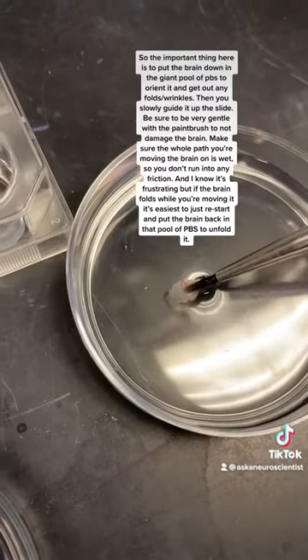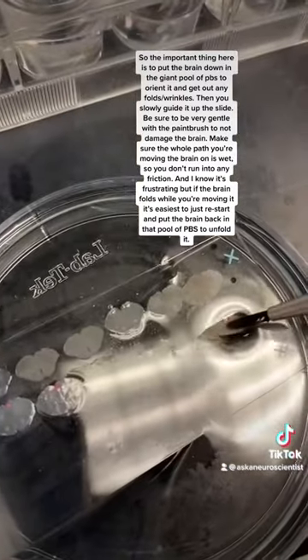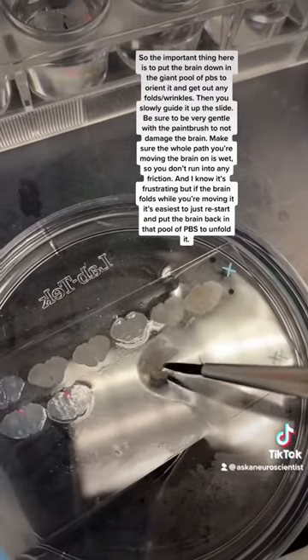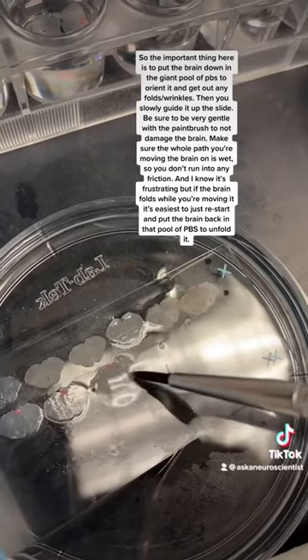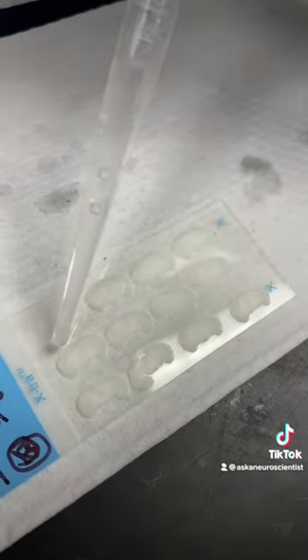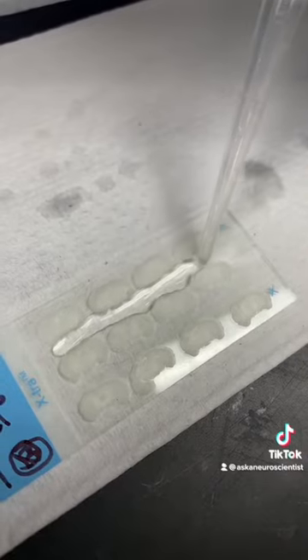What I've done here is I have my little paintbrush and I'm just going to very gently pick it up — you really hardly have to do anything. The brain is going to stick to the paintbrush. The key thing here is that the slide is partially sitting in the PBS, so whenever I put it down it's still in a puddle. This is moving really fast — I'll put words on screen to explain the rest of that part.